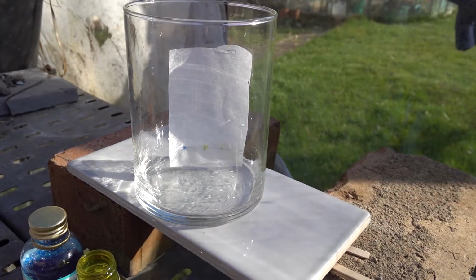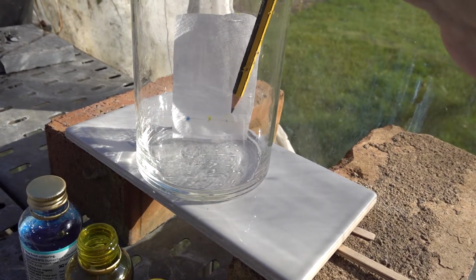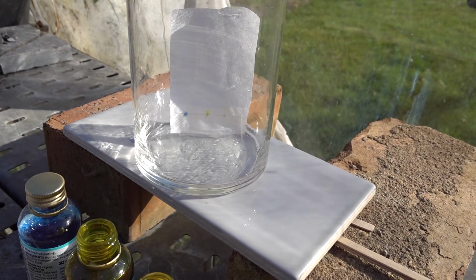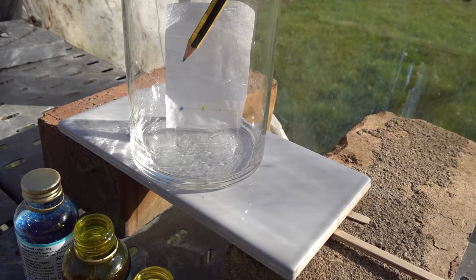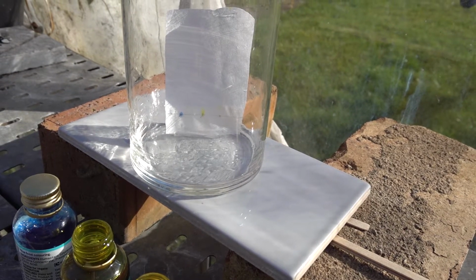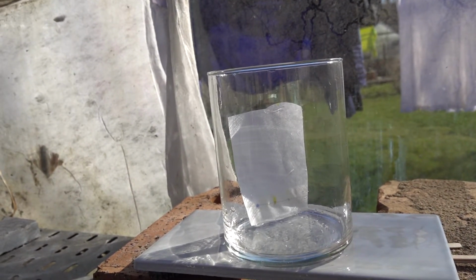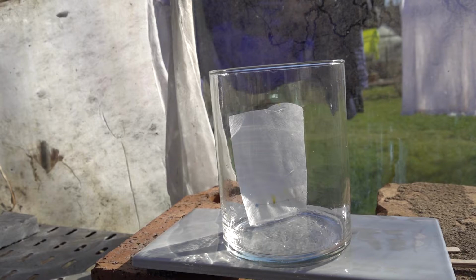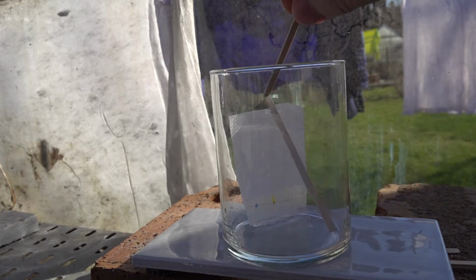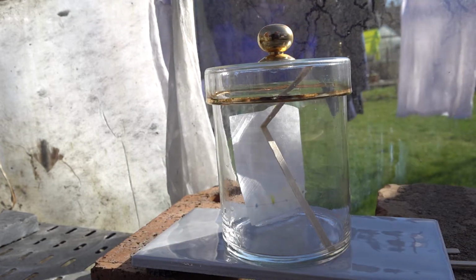And you might be able to see that the sample on the right, the curcumin, is moved with the solvent. We've got some movement of the material for the green spot, the yellow particularly, but the blue, as of yet, shows no movement. We need to let this chromatogram run a little time, and we also need to place a lid on the material. With paper chromatography like this at home, the paper does tend to sink sometimes, so I'll just prop it up with a little splint there and put the lid on whilst we let that run.